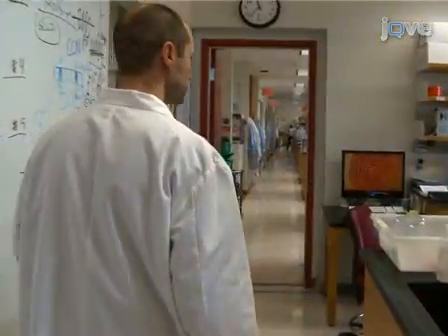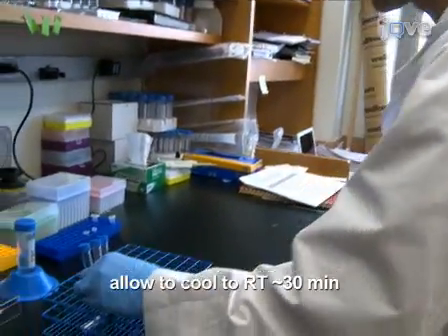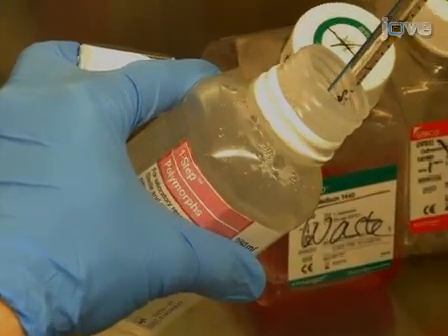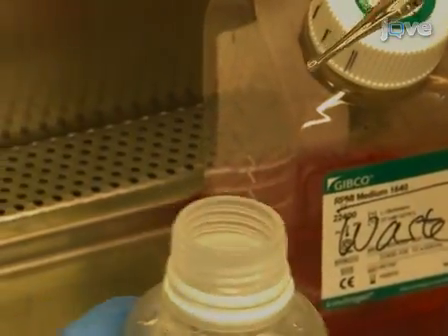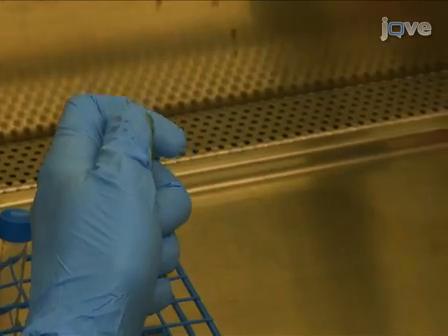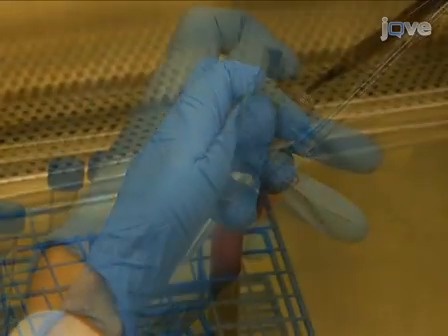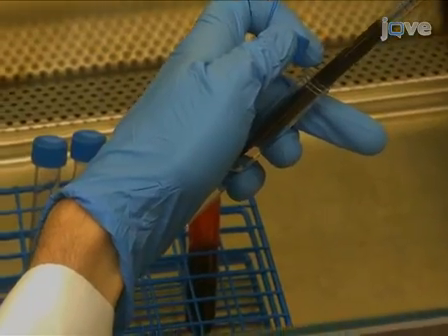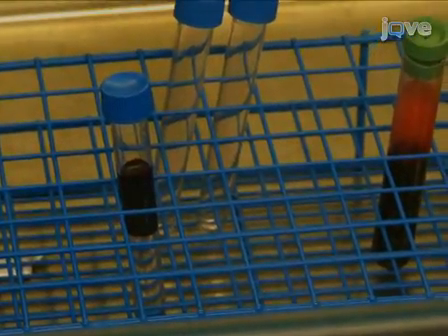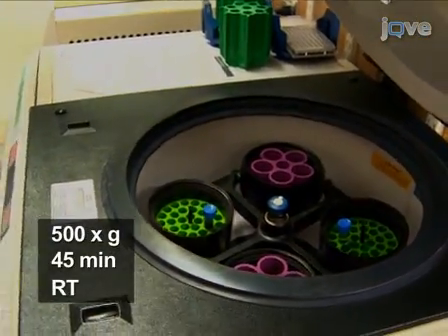After obtaining human blood from a healthy donor, allow the blood to cool to room temperature — this takes about 30 minutes. Once the blood is cooled, gently pipette 3 milliliters of room temperature polymorph density gradient media into an 8 milliliter round-bottom polystyrene tube. Then gently add 3 milliliters of whole blood on top. It is important to avoid any mixing. Place the tubes in a centrifuge and spin at 500 g for 45 minutes at room temperature.